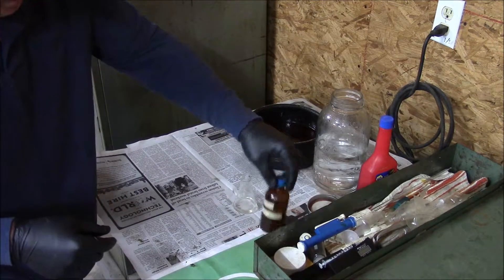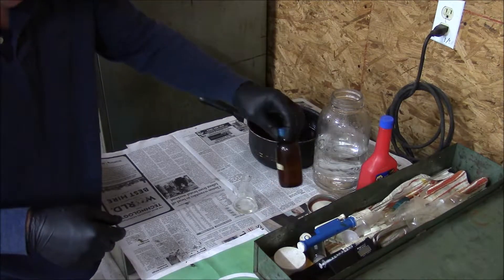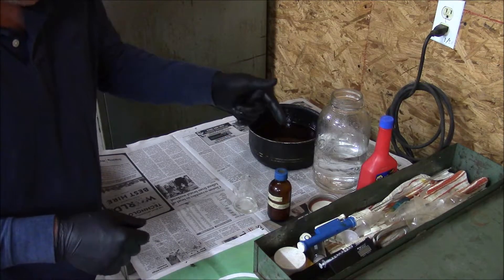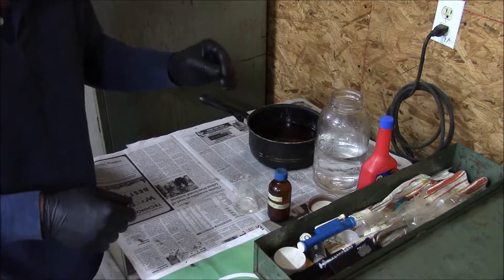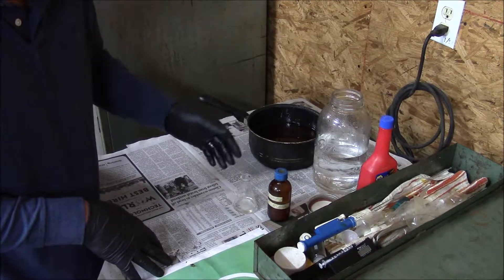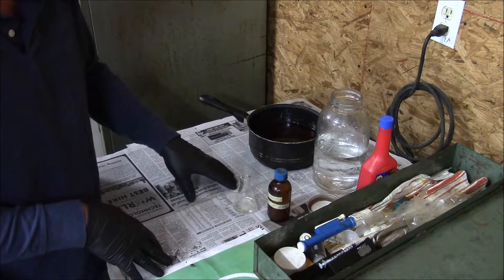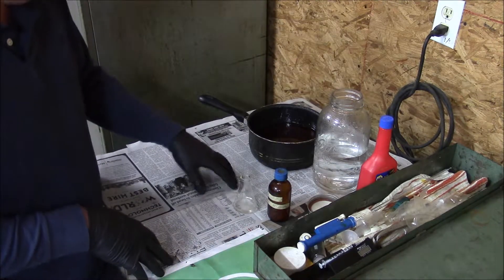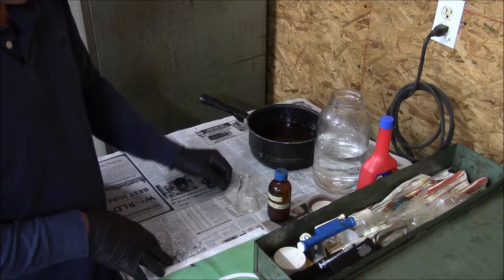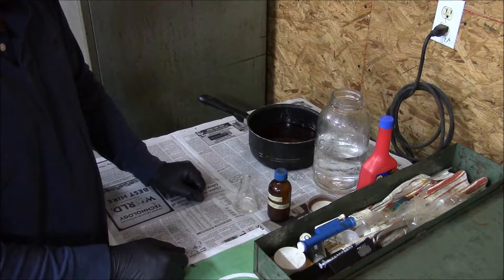Next, we're going to put an indicator solution in. I use turmeric and isopropyl alcohol and it'll make a yellow solution. Turmeric will change colors at about 8.5 pH, which is about the pH that phenolphthalein — the other indicator a lot of people use for titrations — will change at. I found that turmeric was cheaper and more easily available than phenolphthalein.